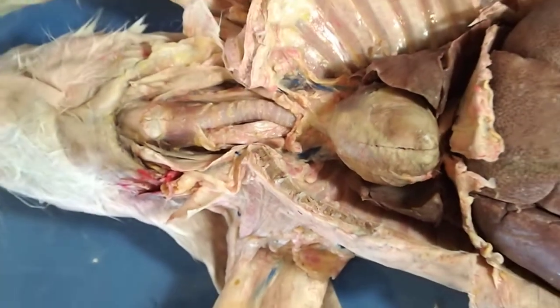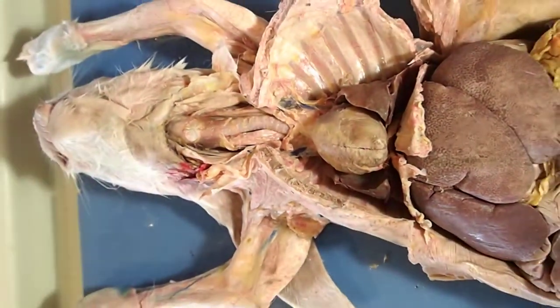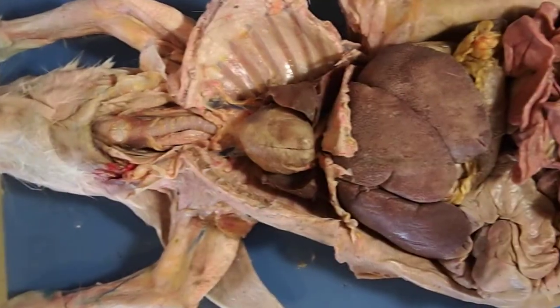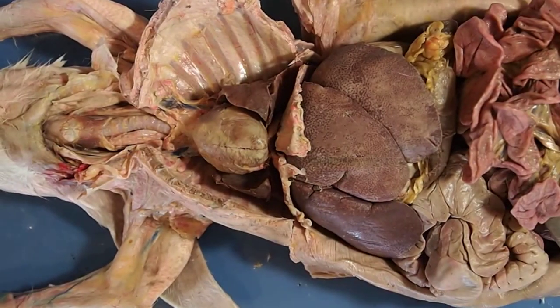Those are the thoracic cavity organs. We'll come back later to look at blood vessels found here as well in another video.